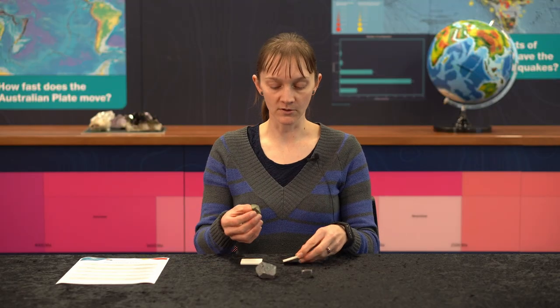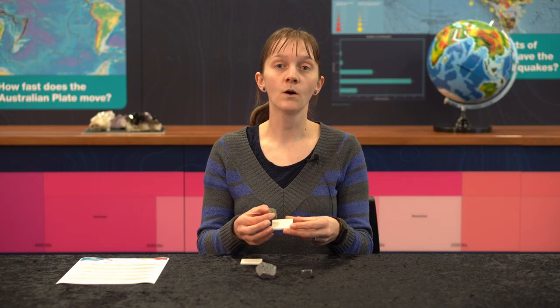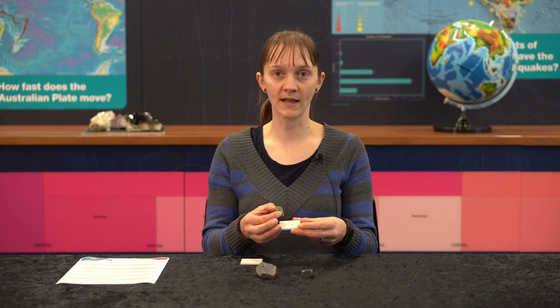Hi, I'm Katie from the Geoscience Australia Education Centre. Today I'm going to show you how to use the streak test to identify minerals. The streak of a mineral is its colour when powdered, and we find it by scratching the mineral across a piece of unglazed porcelain tile or a streak plate.